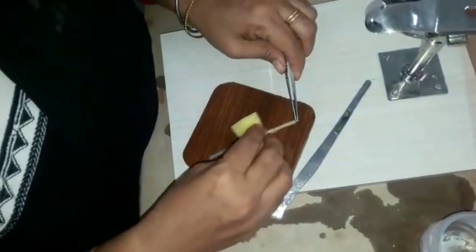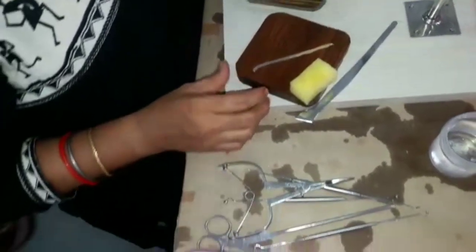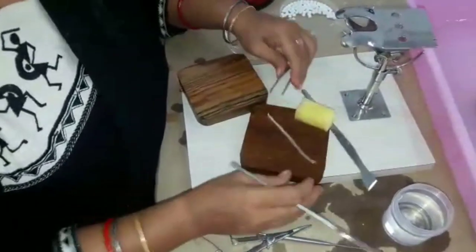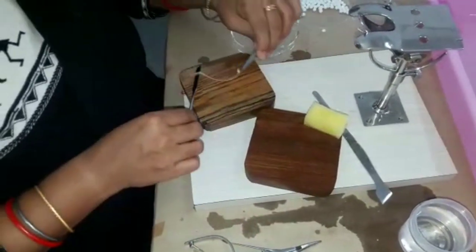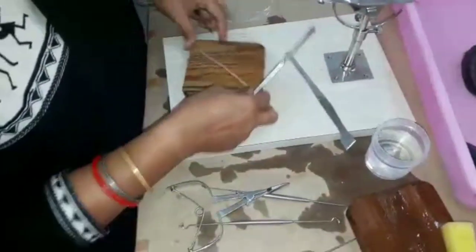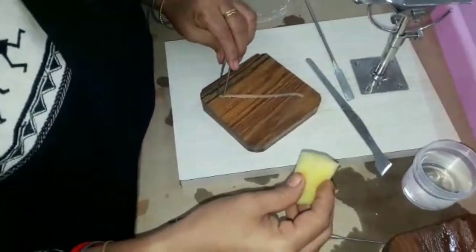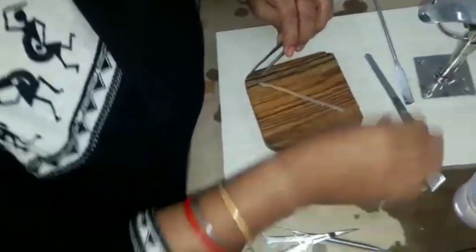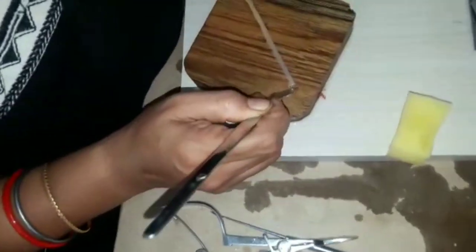The mantle ribbon is then transferred onto a fresh, moist wooden block. Small graft pieces are then cut off from the ribbon. The grafts prepared are kept in moist condition to maintain their viability.